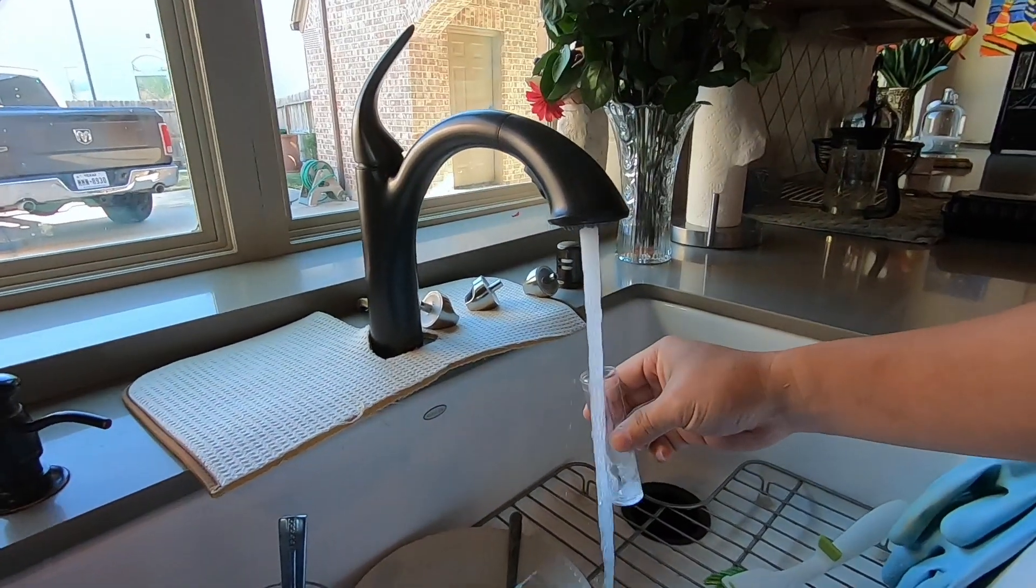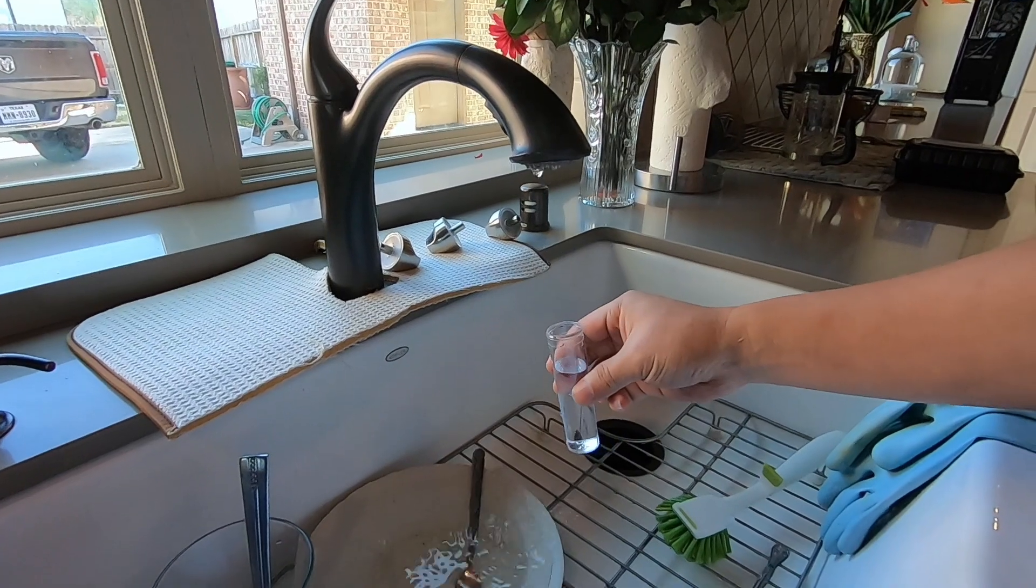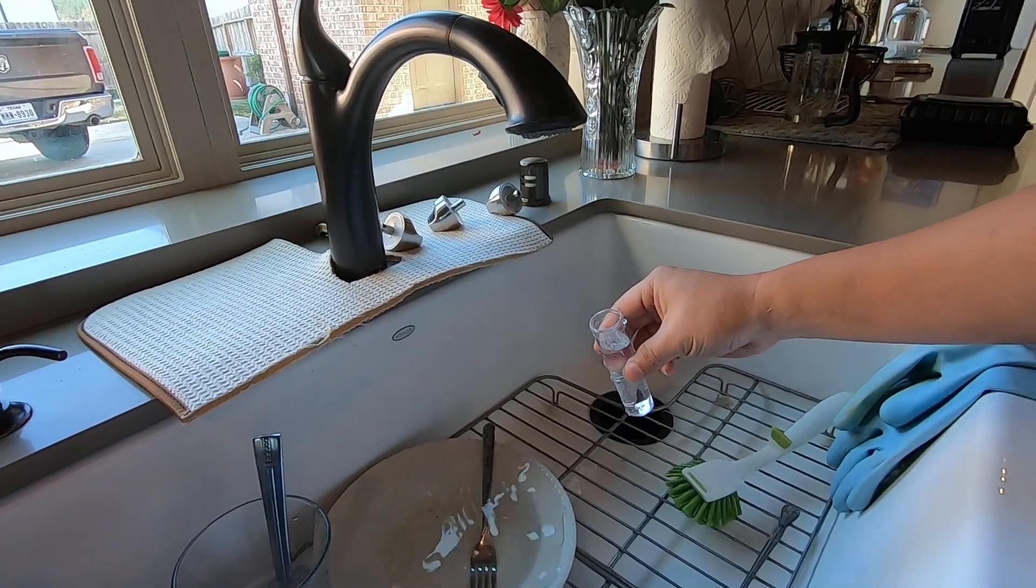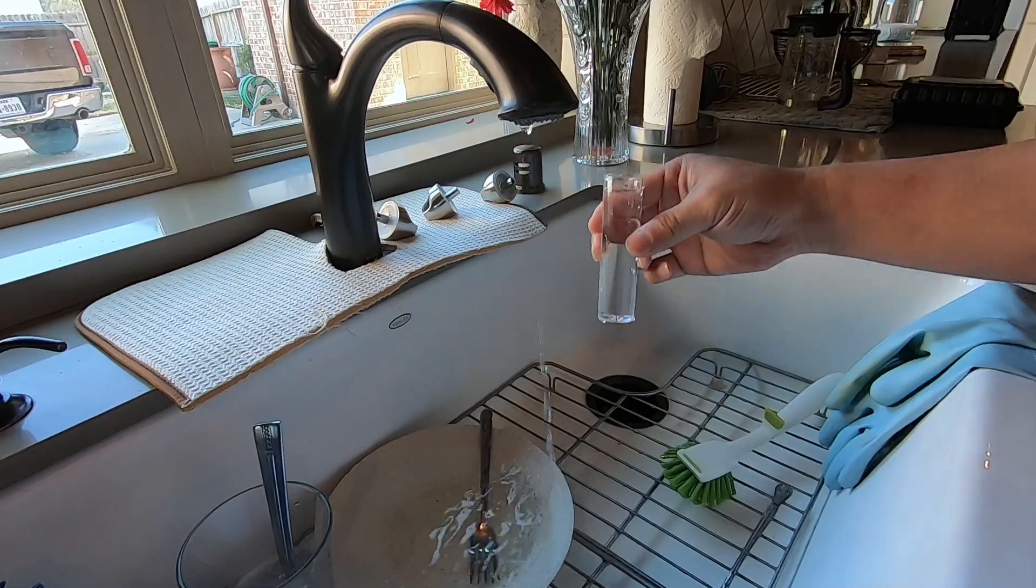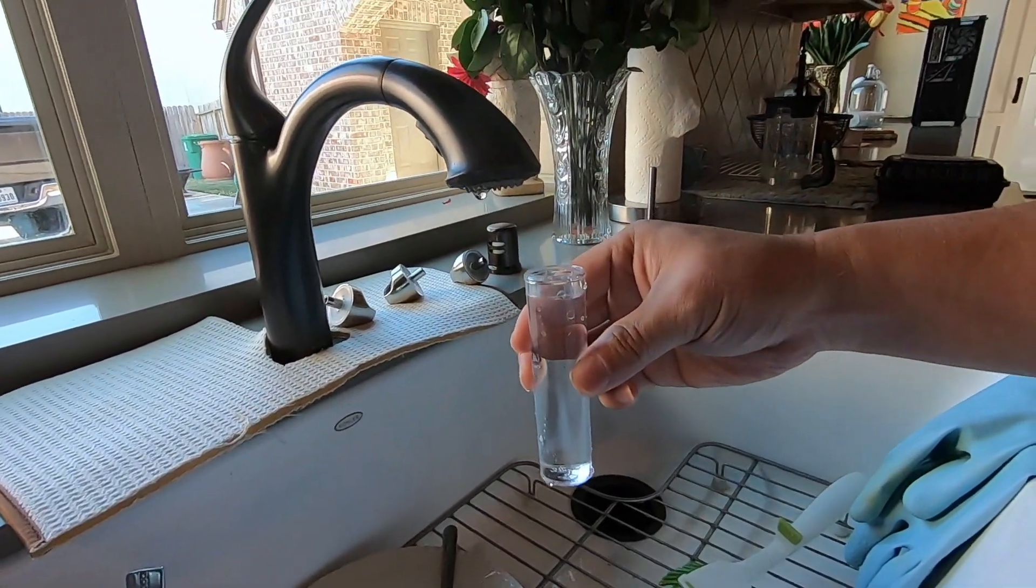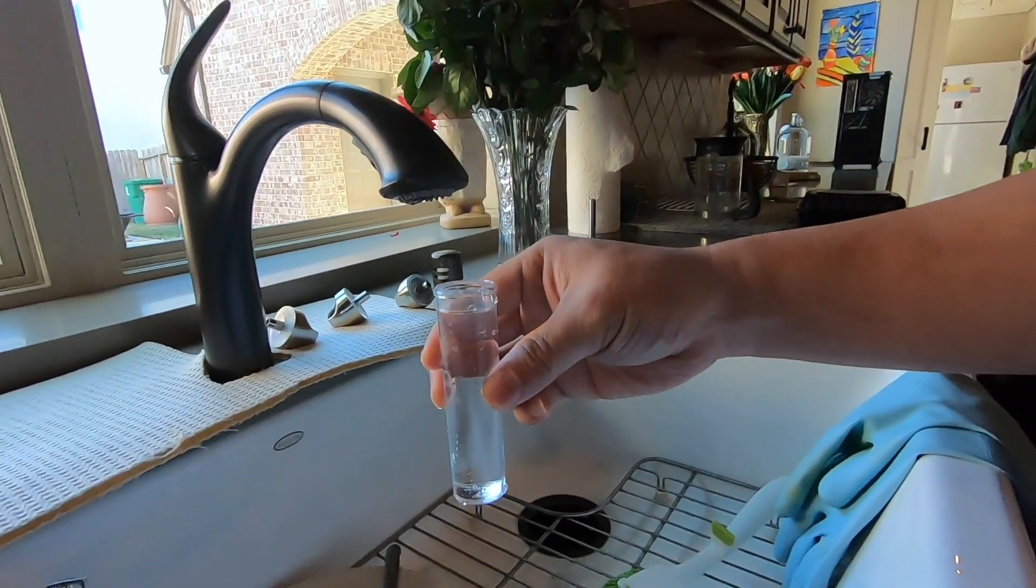So make sure you run this for at least 30 seconds before you start filling this up. Alright, so here we go. Okay that's too much. We got it there exactly at the line.